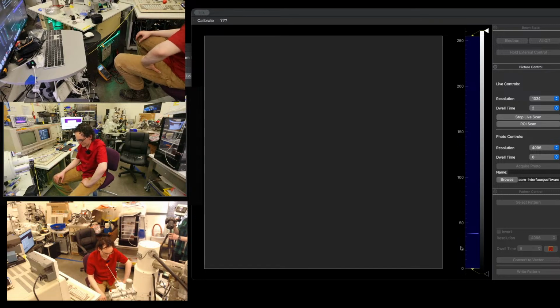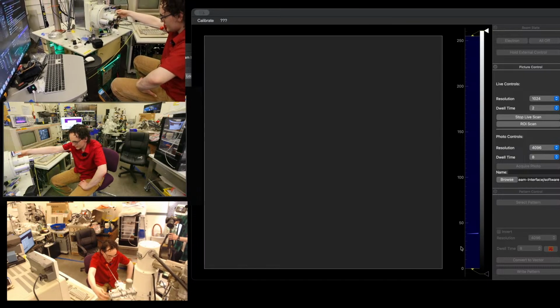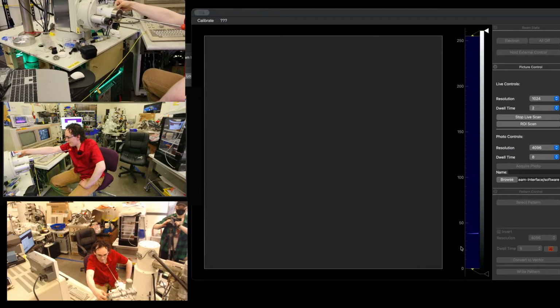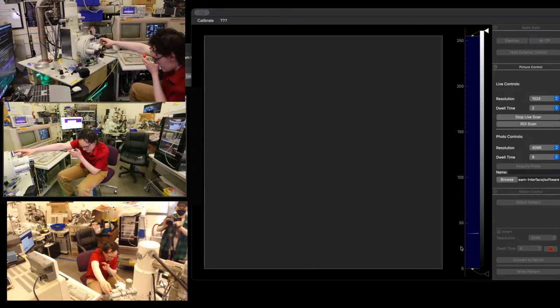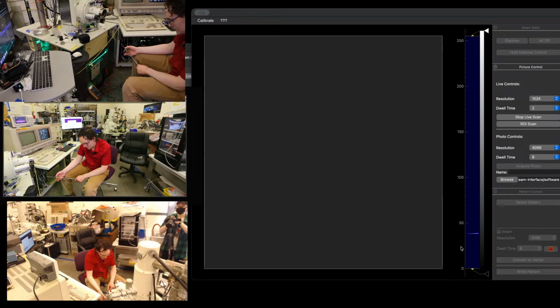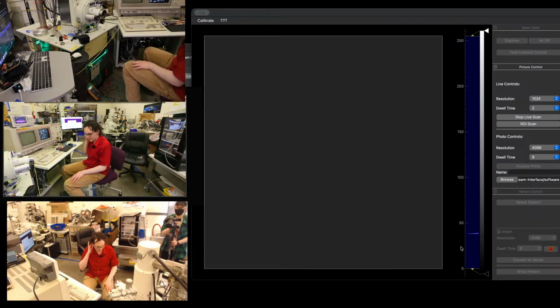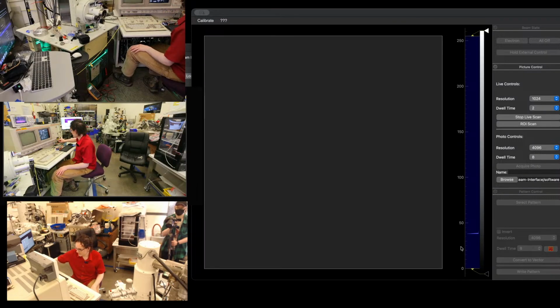Something on the O-ring there. So we'll cycle that a few times. Okay, let's see if that closes it up now. Okay, so we're going to vent. It's still dropping. Let's see if that continues to drop. Okay, so I think we dislodged whatever is on the load lock door, so that needs to be pulled apart and cleaned. Well, it's still dropping. So it's lower than it was before even. So I'm comfortable proceeding with that.